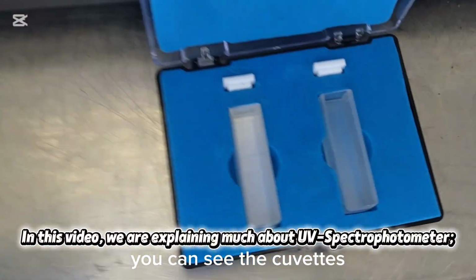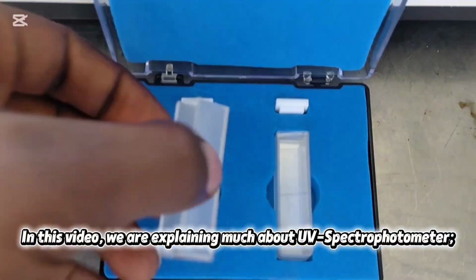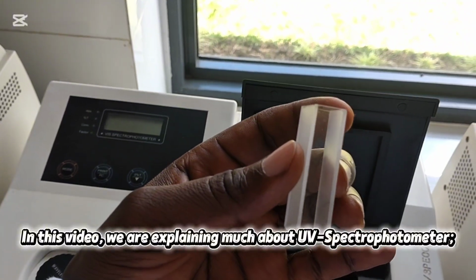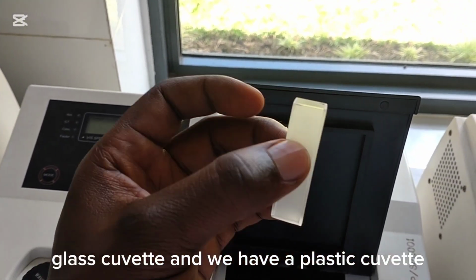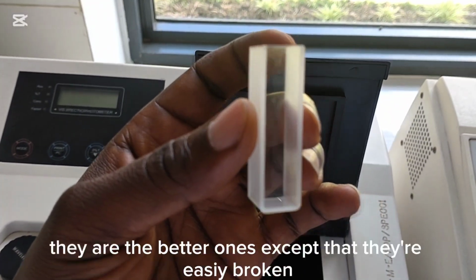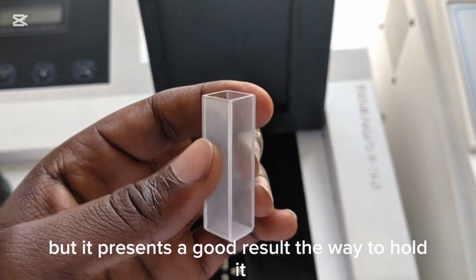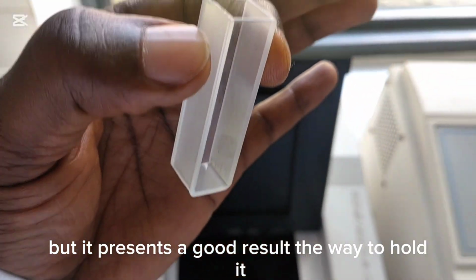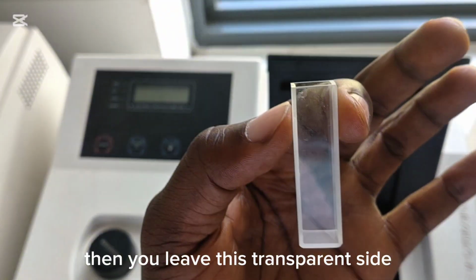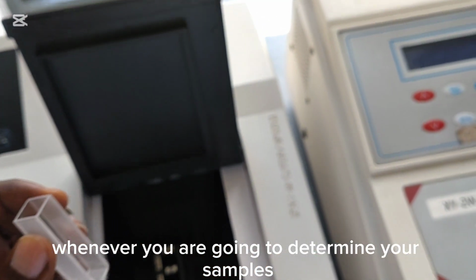You can see the cuvettes. There are two types of cuvettes. The first one is the glass cuvette, and we have the plastic cuvette. The glass ones are the better ones, except that they break. You see, but it presents a good result. The way to hold it, you hold it by the opaque side, then you leave the transparent side, and you have to clean it whenever you are going to determine your samples.